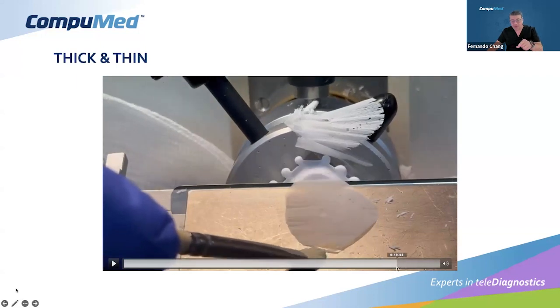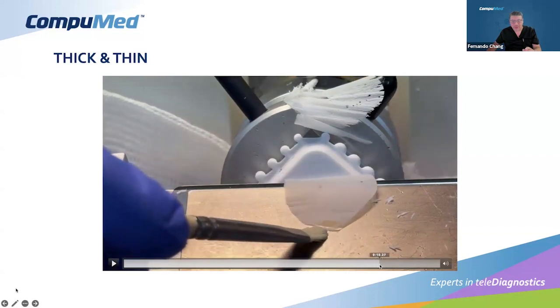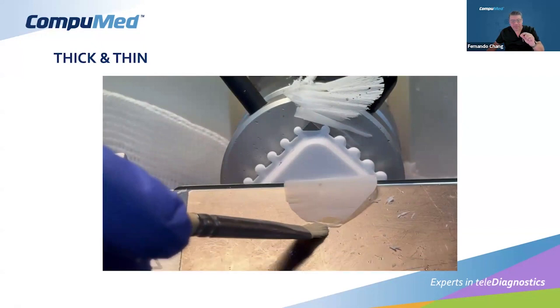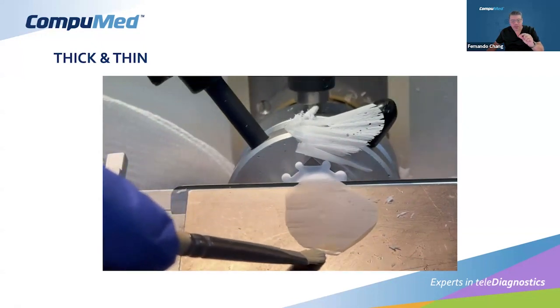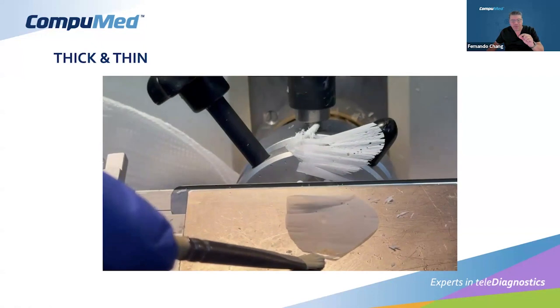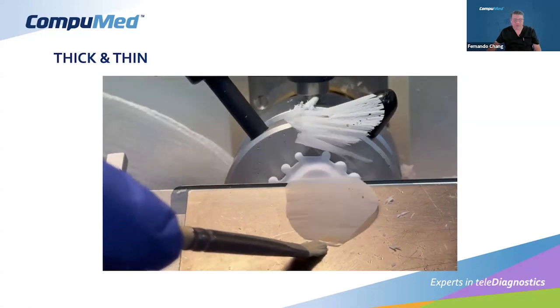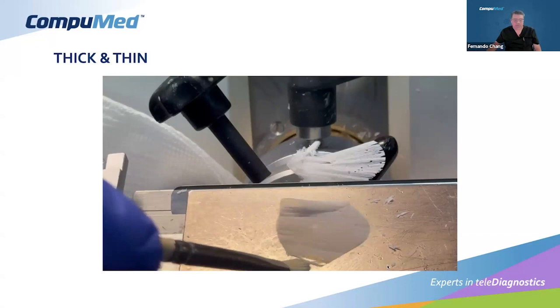Another important thing in this slide: you can see the shatter here. It's really bad shatter. And also, remember the ideal temperature, we can actually observe it here. Look how, immediately as you take the section, we're taking this section right there, and look at the technique, how you, with the brush, really barely touch the corner. And then you can see how immediately it curls, because this is not the right temperature. So we know this is too cold, okay?